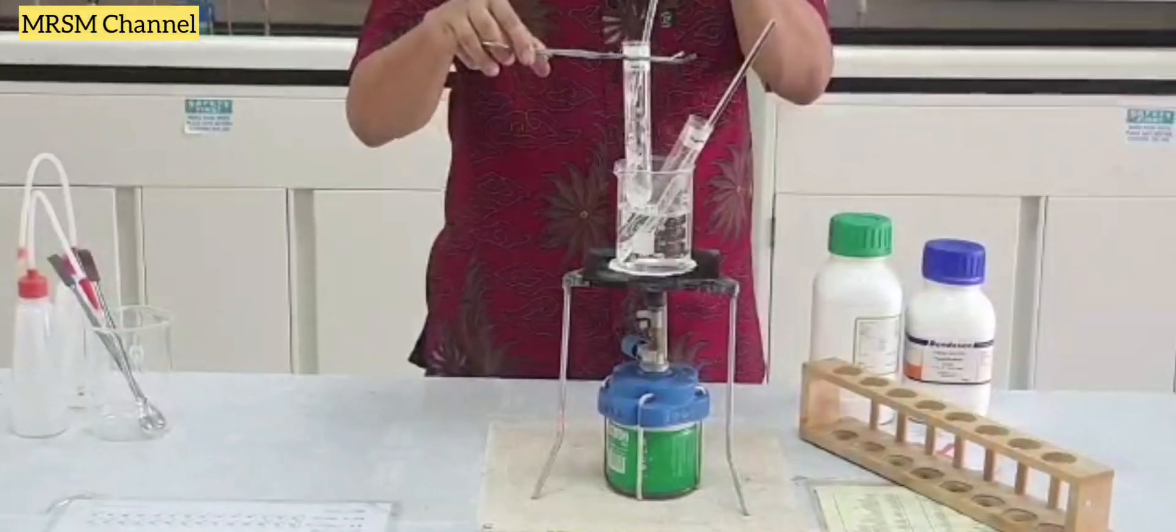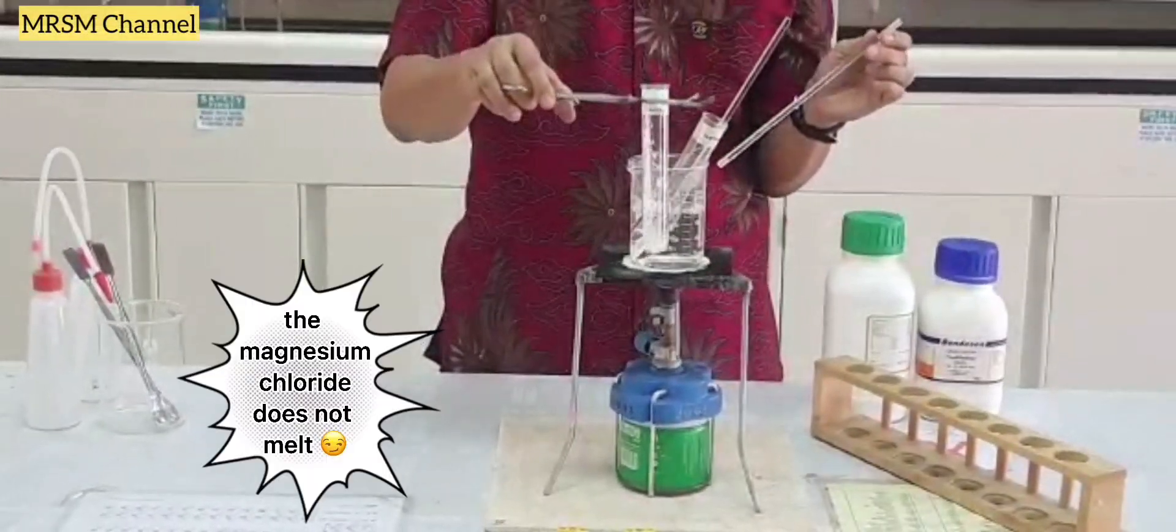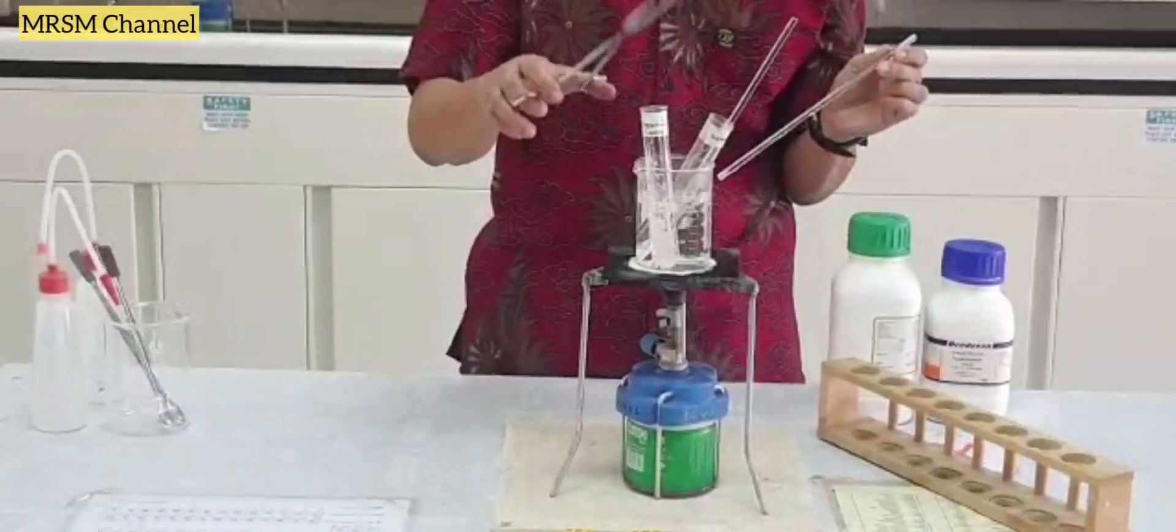And now look, it does not melt. What does this mean? Talk to your teacher to find out. Thank you and have fun.